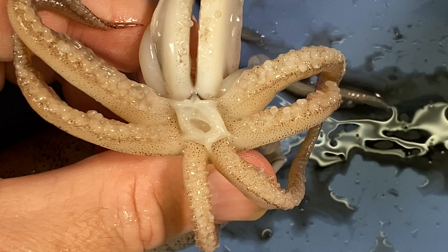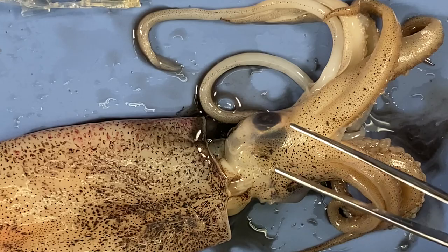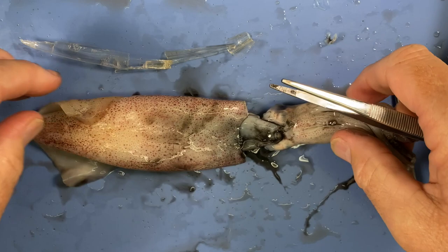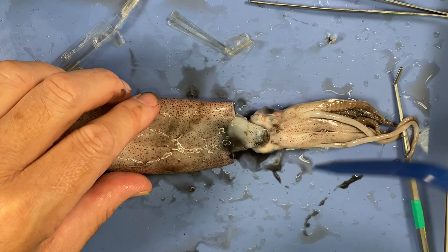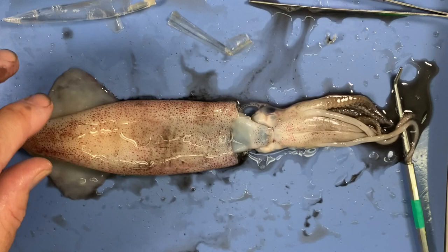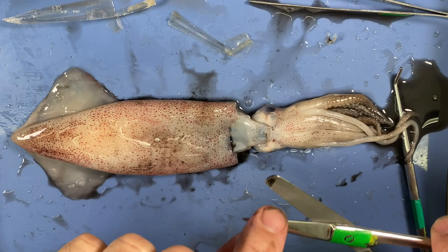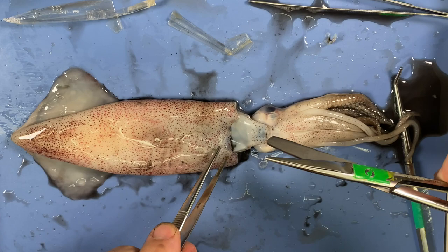This is probably the quickest dissection you'll ever do — it's very easy. I'm going to flip it over. Look at all that ink — the black stuff is ink. I'm on the ventral surface now. I'm going to use the blunt end of scissors so I don't destroy the tissues inside, and cut right down the middle of that almost U-shaped part.